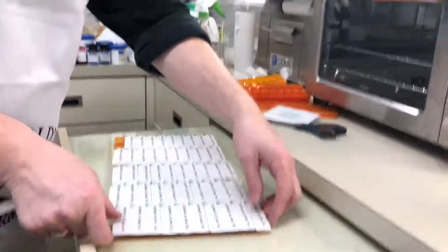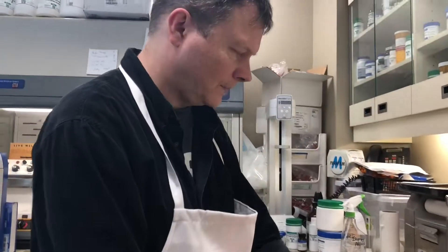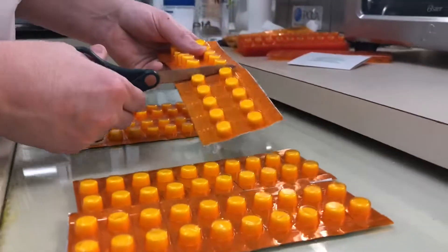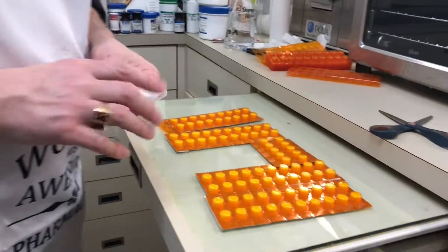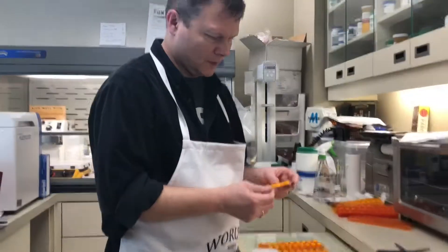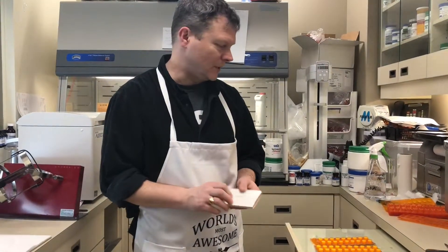We've just finished packaging all of these. To package them in a form that will stay intact, we cut the 20 into two sets of 10 and slide them into the sleeves. Store them at room temperature, not too humid. When you want to use them, simply peel back the paper and take one out instead of pushing through. That is how you make sublingual rapid dissolve tablets. Thanks for joining me, and thanks to Adam and Cam for helping film this.